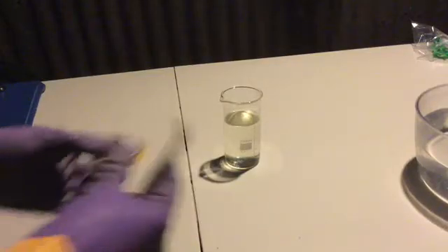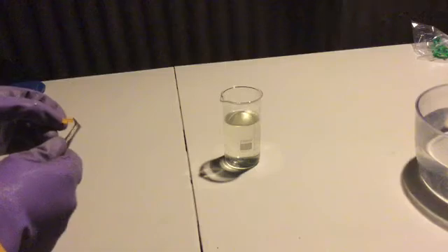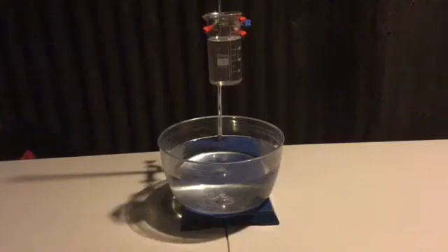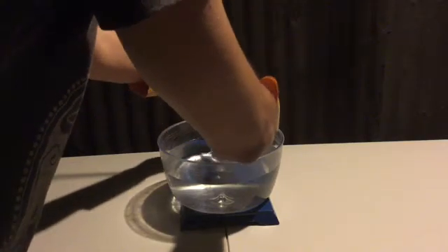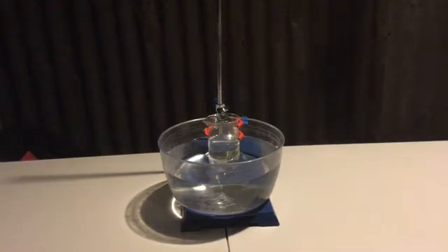While the solution was cooling, I decided to take a pH test. While it is quite obvious the solution is very basic, I decided to carry one out anyway. I have changed the gloves I am wearing to a more protective, thick pair, as the solution evidently corrodes thin gloves very viciously. When the solution was cooled to room temperature, it was placed in a cool water bath. It's very important whilst performing a recrystallization to cool the solution gradually and slowly. Cooling the solution too fast will result in impurities in your final compound and the highest purity will not be achieved.